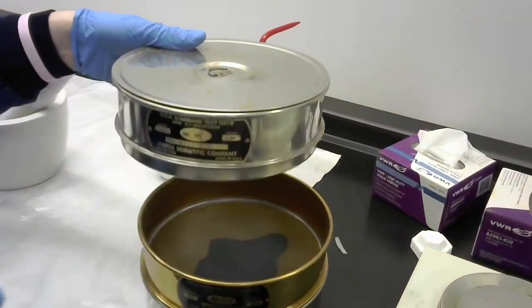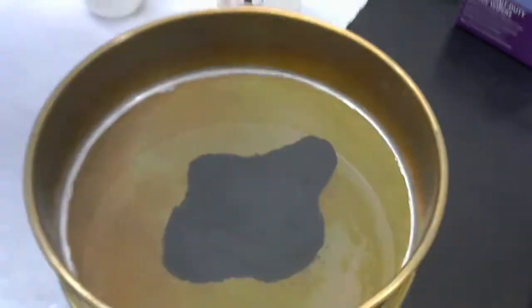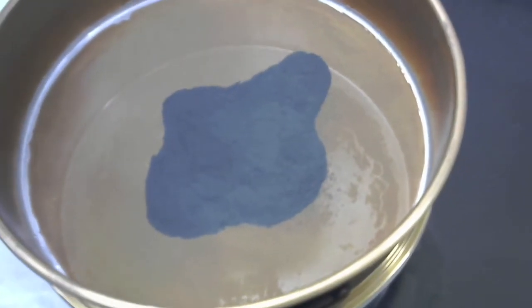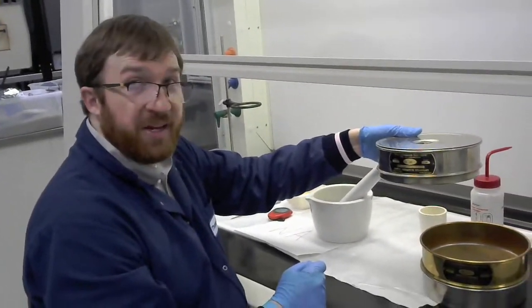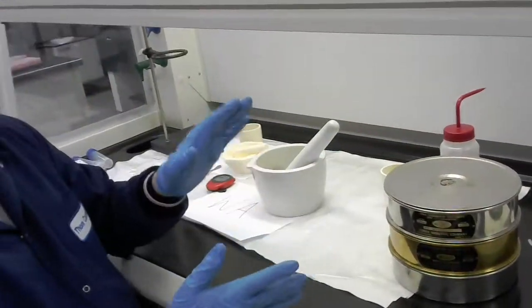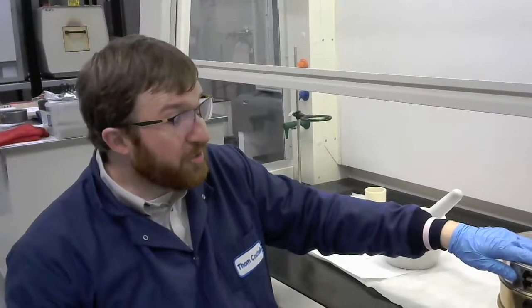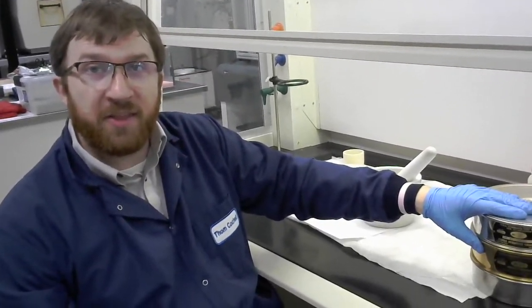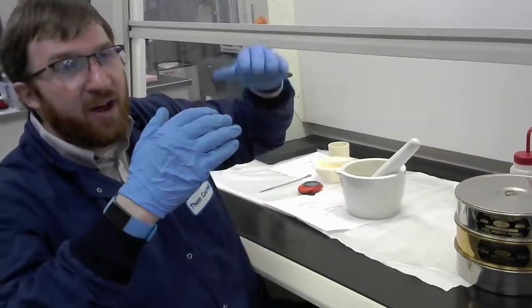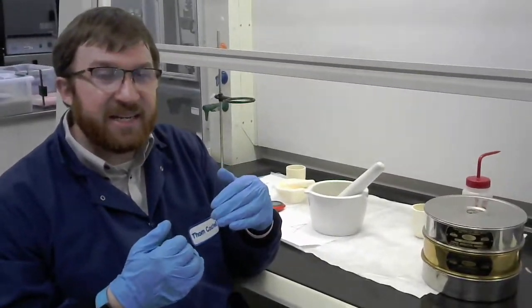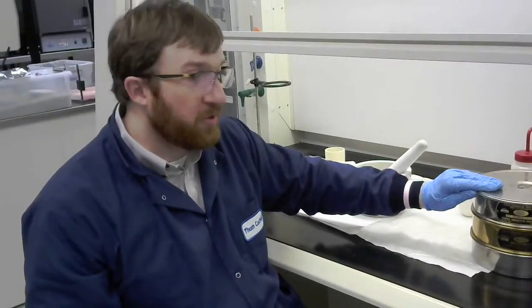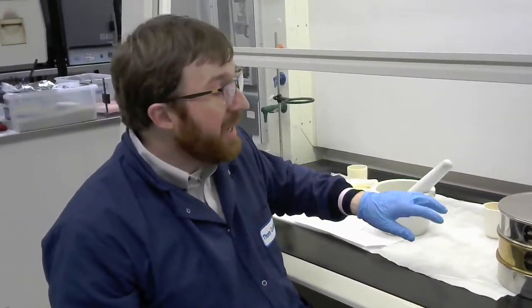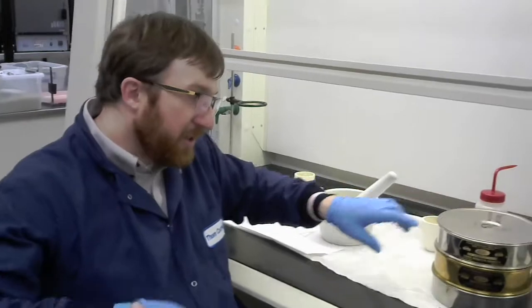So then let's go ahead and take a look at what the next level looks like. Alright. So you see a pretty good mound of powder. So this is all the powder that made it through 80, but not through 325, right? So that's a pretty good portion of our powder. So basically through process of elimination, we can say it's smaller than the 80, larger than the 325. So that kind of, and again, if you have enough of these sieves, you can get a really good idea of how much of your powder is in what size, right? So we're still going to need to grind that, but I'll probably concentrate on the first level first. So I'll take that back, grind it for awhile, and then see if it goes through and then add back the stuff that was in 325. Alright. So let's look at the last one then. So I'm going to take off both of these and see what made it through.